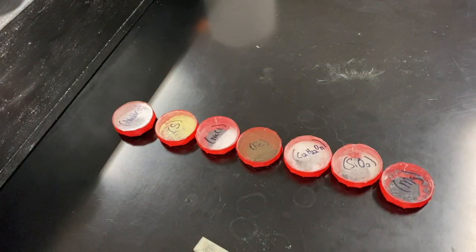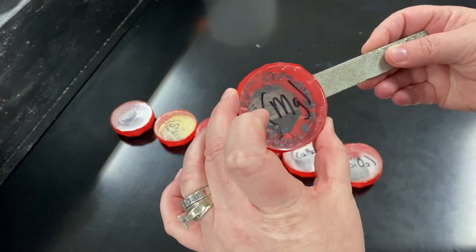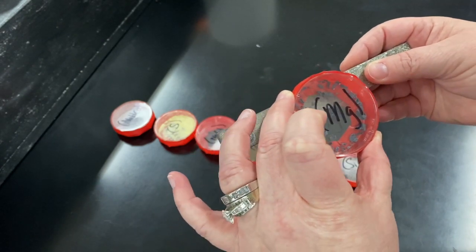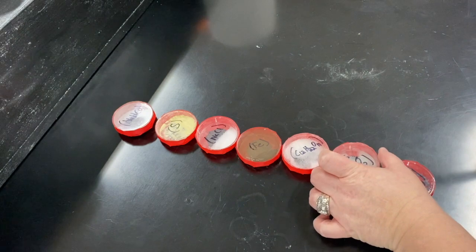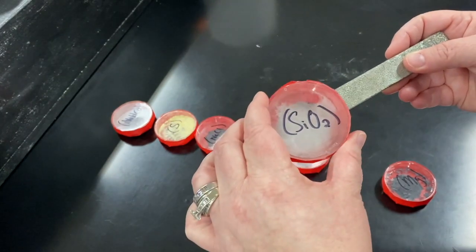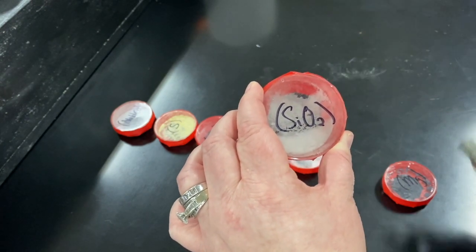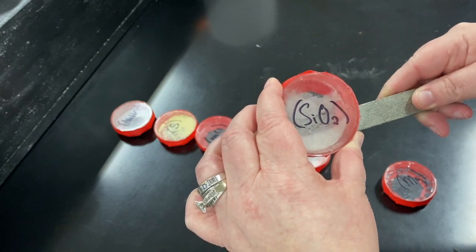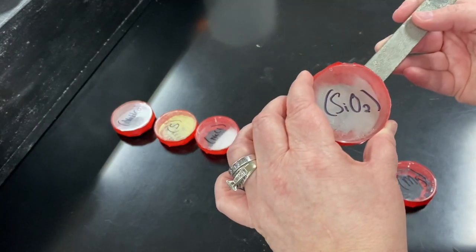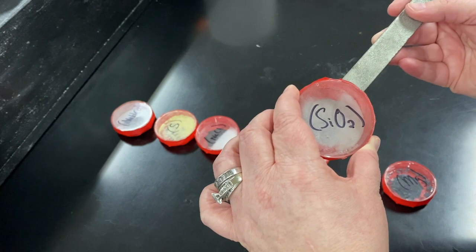The next step, again without opening these petri dishes, is to look at what a magnet does. Does a magnet attract or repel any of the pieces of magnesium? And that's a no. Does it attract or repel silicon dioxide? It looks like it's repelling it just a little bit — surprisingly, a small effect. But no, that was just the tilt of the petri dish, so no effect on that.